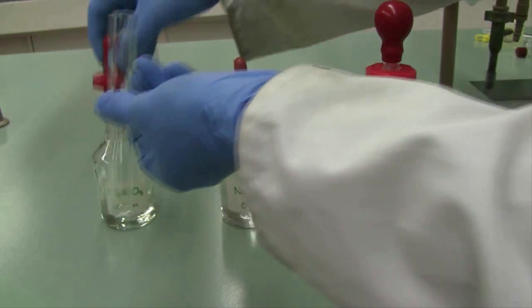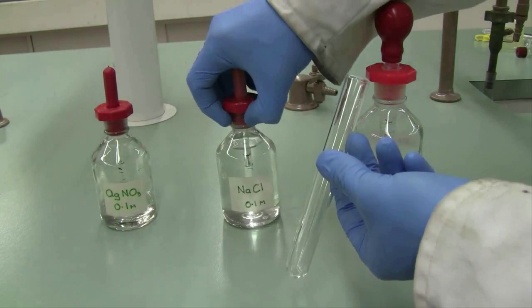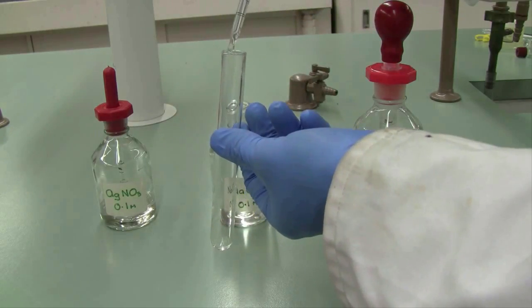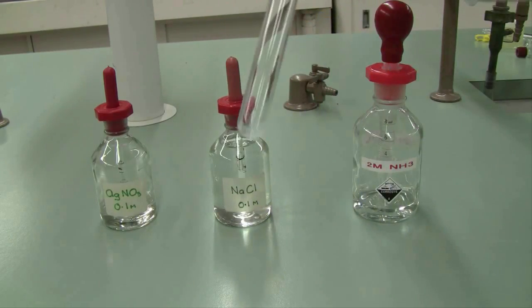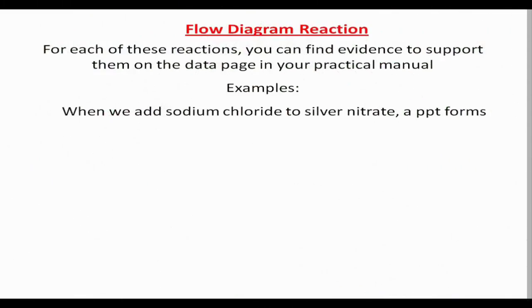I'm going to take a small quantity of silver nitrate, and I'm going to add a drop of sodium chloride to that silver nitrate. By observation, you can see the formation of a cloudy white precipitate. Now, for your flow diagram for writing the reactions, you do have some assistance in your manual. You have a lot of data to support your observations. So for our first example, adding sodium chloride to silver nitrate, we notice a precipitate forms. So we can write a chemical reaction to show that.